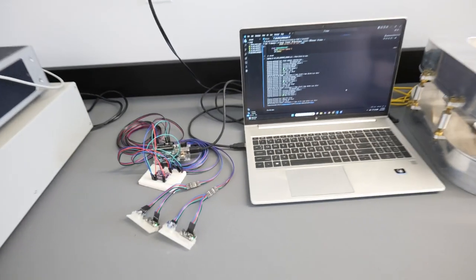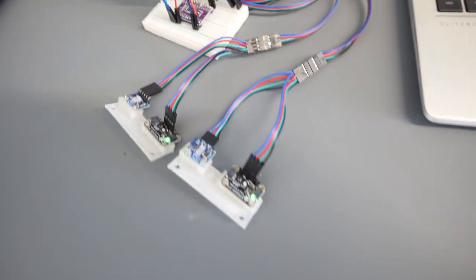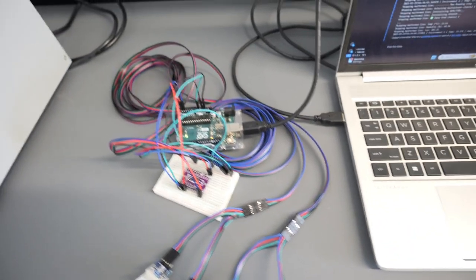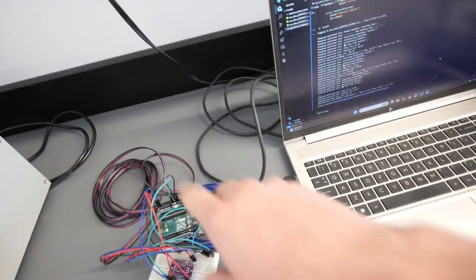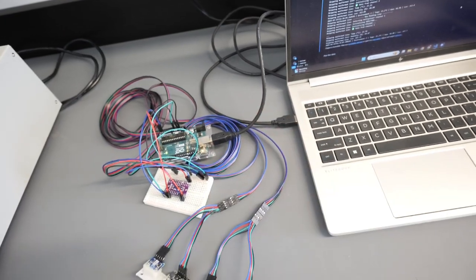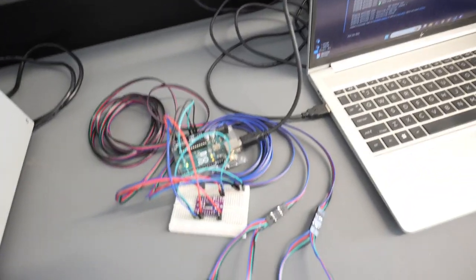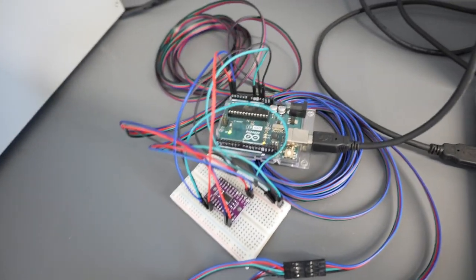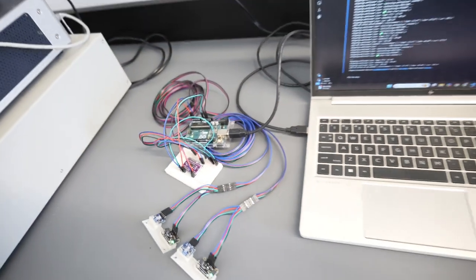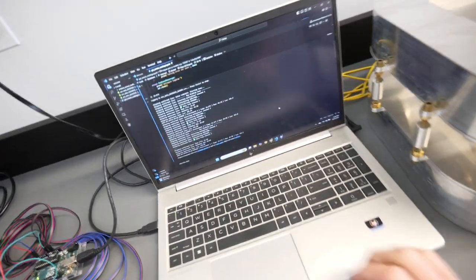As you can see here, these are the sensors that are connected. There's a bunch of wire because these will go inside of the environments, and all these parts will stay sort of close to the laptop. And so, yeah, this is the final sort of situation. Not the cleanest setup, but gets the job done.